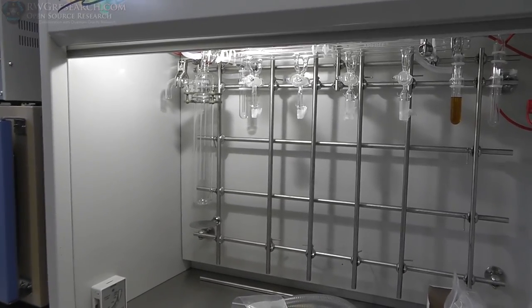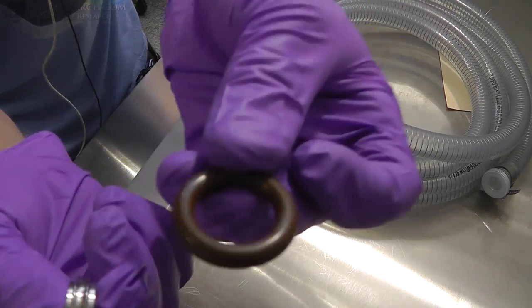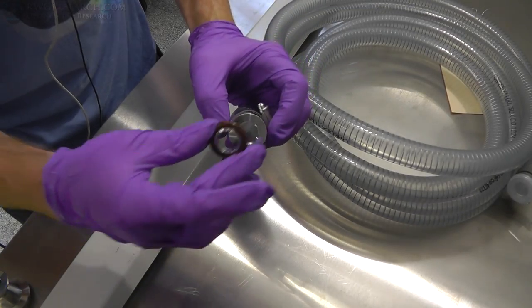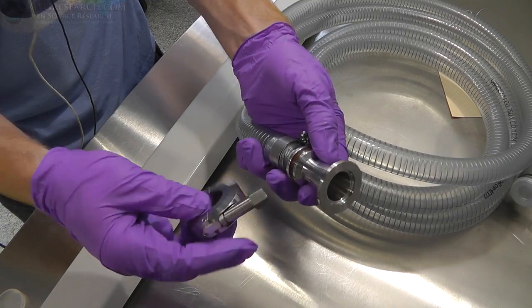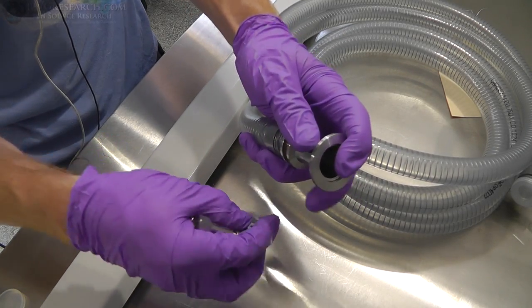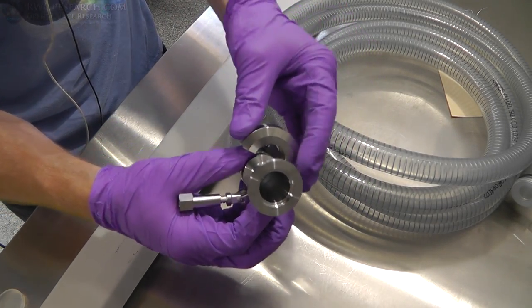Yep. All right, so I'm gonna show you how these flanges fit together. This is a metal insert with an O-ring. I think that's Viton. Then it just fits in here like this. The other side fits in here like this, and this clamp, all it does is just clamp the two together and squash that ring. It's a very simple, nice, quick change system.